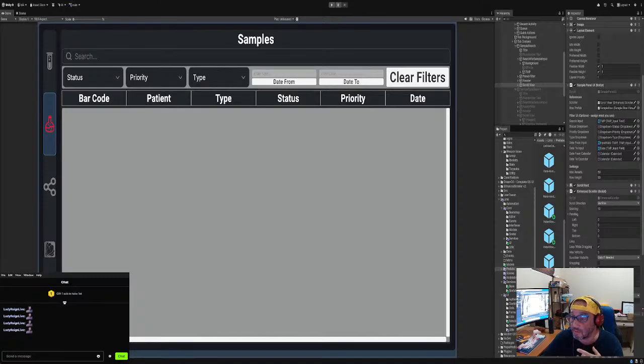So let's get started. From the last time, we got stuck on the calendar dates, correct? I got a fix for that, and the fix was, it's always something very silly: I got the date format wrong. I was mixing up the date formats. So let's take a look at that.